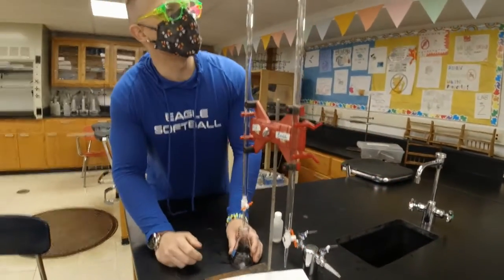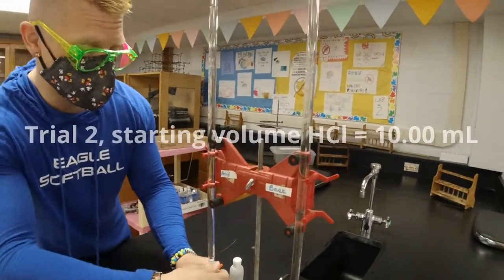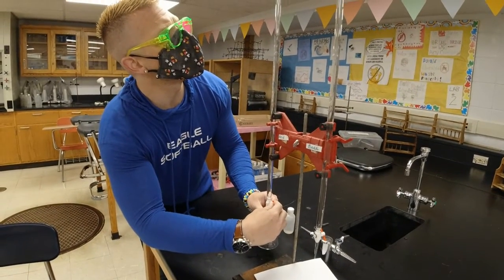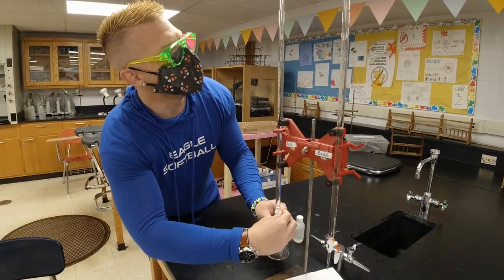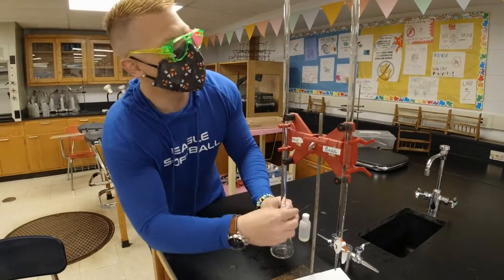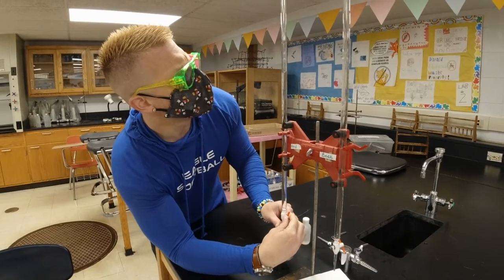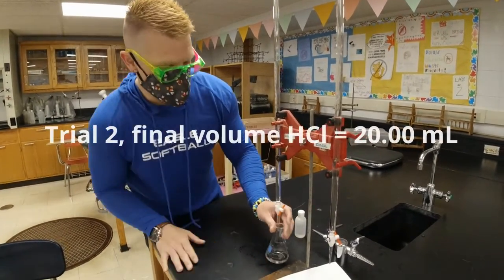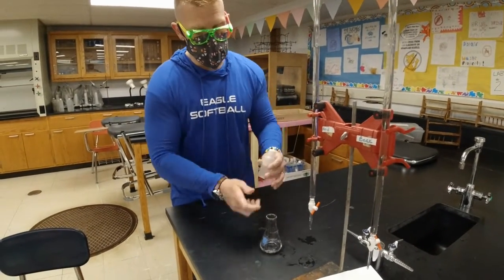All right, so right now I'm at 10 milliliters, and I need to add another 10 milliliters of our acid. So I'm going to open up and drop down 10. 12, 13, 14, 15, 16, 17, 18, 19. Now I'm getting close. 20 milliliters will get me to the 10 milliliter mark. So I'm going to slowly open that up. Get it eye level. And all right. So now I've got my 10 milliliters of acid, and I'm going to add my indicator called phenolphthalein.